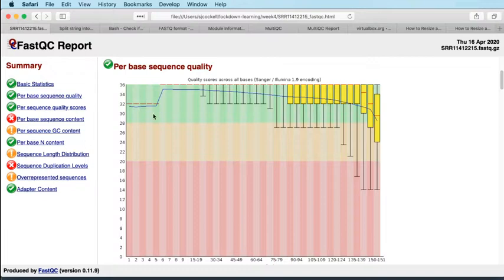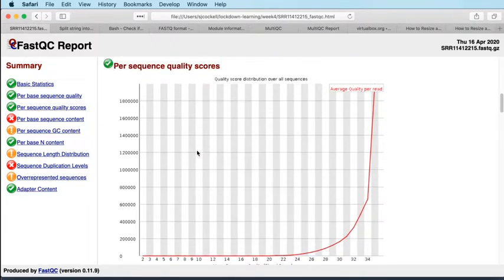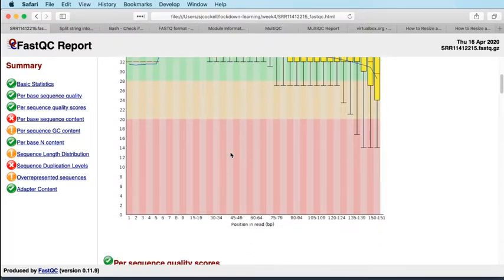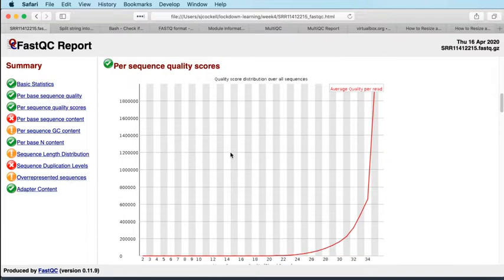Okay, so moving on. So that's the box plot, and a general discussion about Q values in FastQ files. Just to move on from that then to the next one, per sequence quality scores. So this is, instead of taking per base like this, where you're looking at all of the reads at position 1 and summarizing the quality at that position and then doing the same at position 2 and so on, for this, you're taking the average quality for the whole read, and then you're drawing what is essentially a density plot for the average quality across all of your reads in your whole experiment.